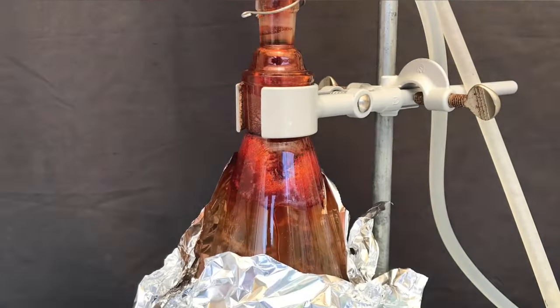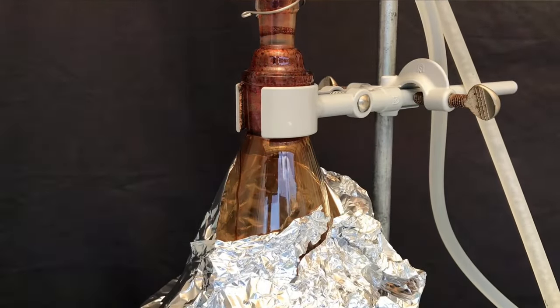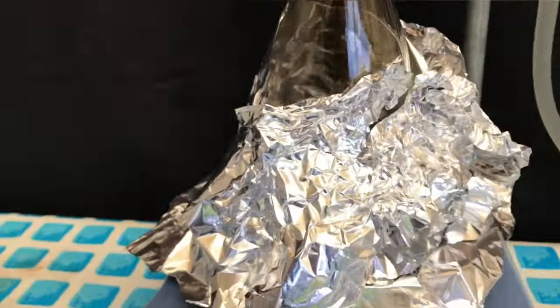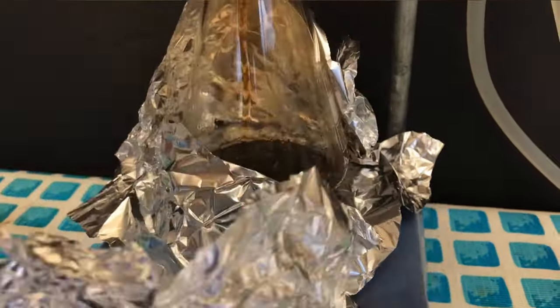We even had to wrap the flask in aluminum foil to make the vapor front climb. It took about half an hour, but afterwards everything in the flask has cleared up. The stuff in the condenser and in the top of the flask doesn't matter, as it won't stay in the flask anyways, so the hot plate was turned off.